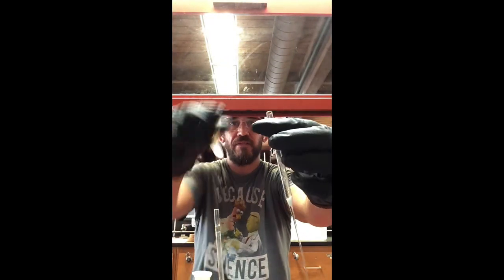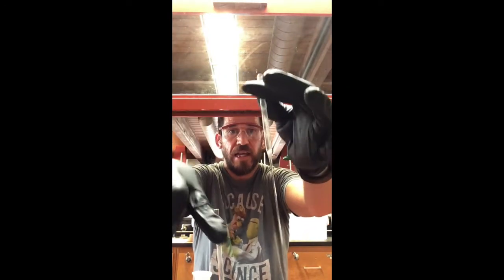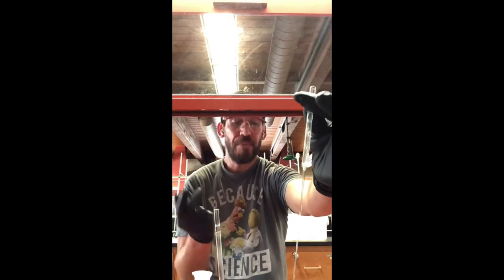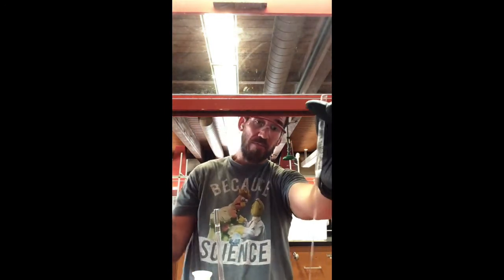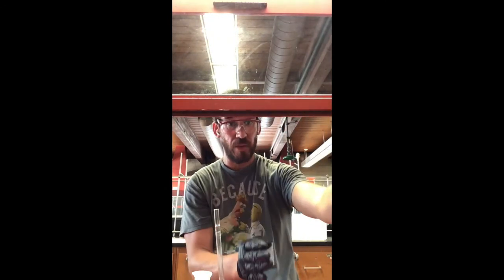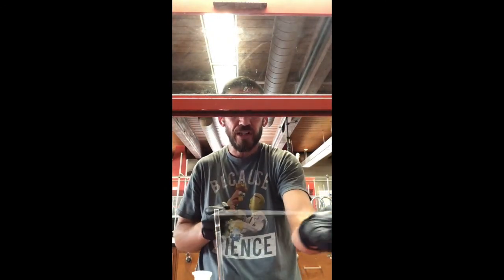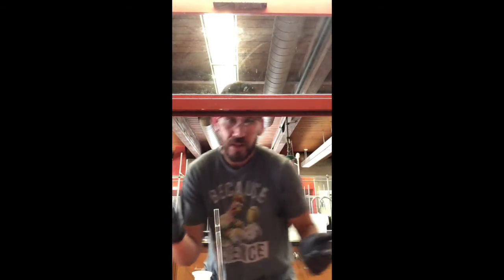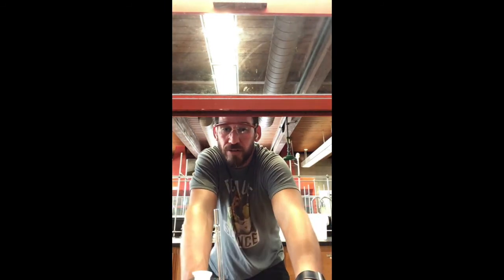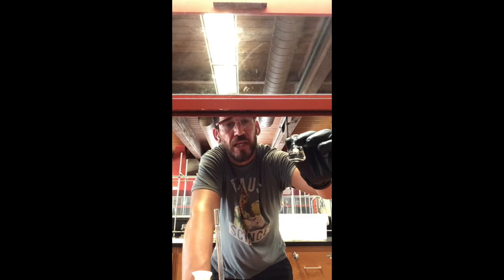The reason why I say that is because if you were to let go of it like this, it's going to suck air through, and then that filter there is going to fly up, potentially move around, and then if you were going to add more liquid to it, it now has an opening because it came up and moved, and now some of that solid material can make its way down, and we've just ruined our filtration process. That's just something to think about in the future. Thought I'd introduce it. The more we introduce it, the more likely it's going to stick, right? So long story short, methylene chloride as well as caffeine in our Erlenmeyer flask.